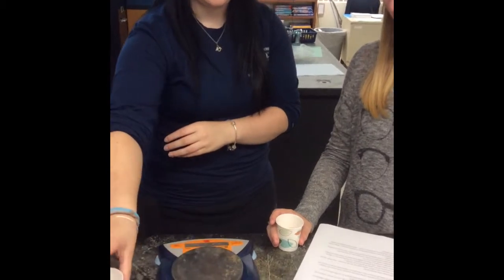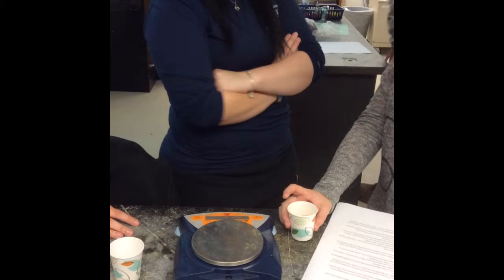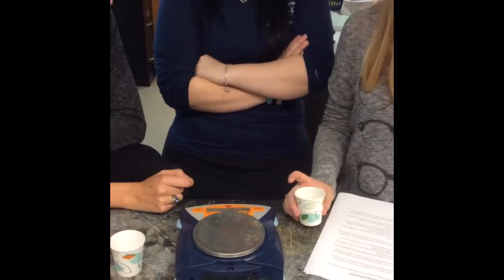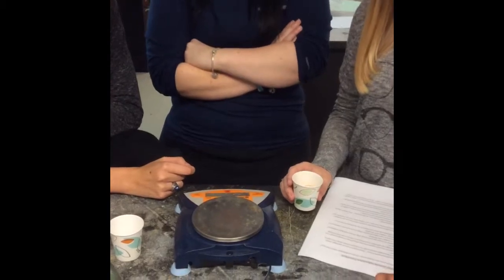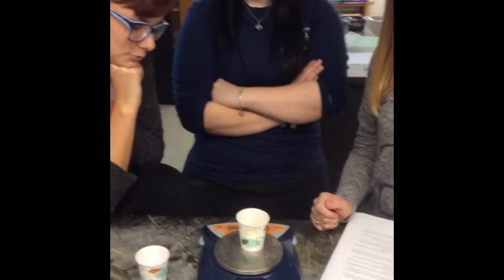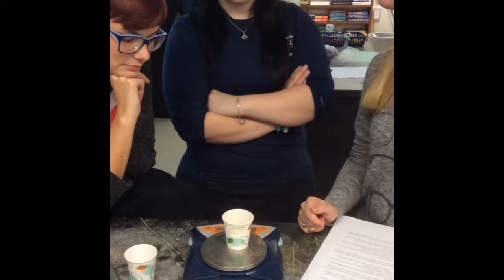What is it? 2.14. All right, so are you documenting that? Okay. All right, so go ahead and do the next one. And what's the units? Grams.